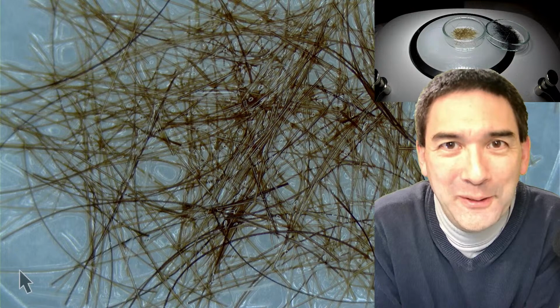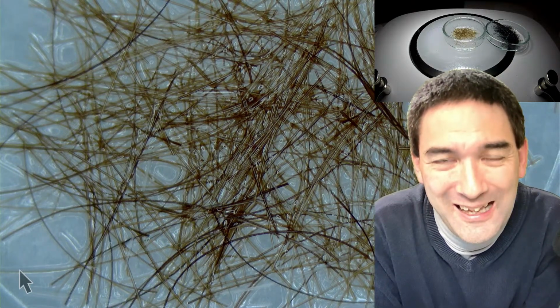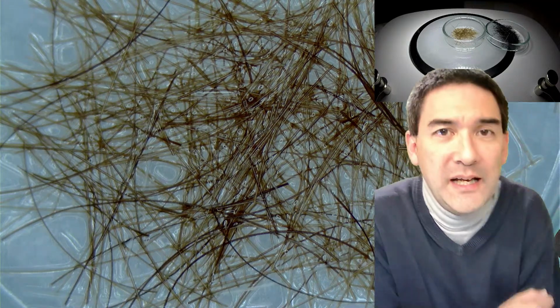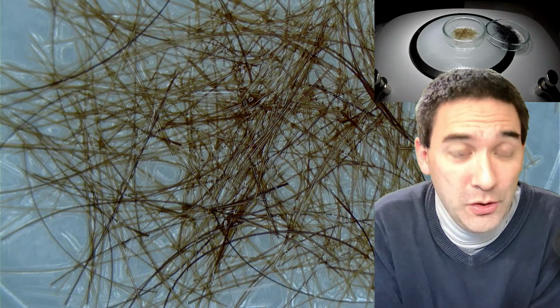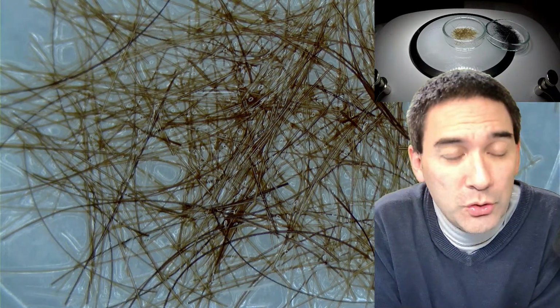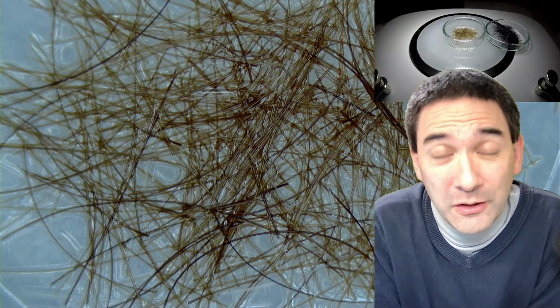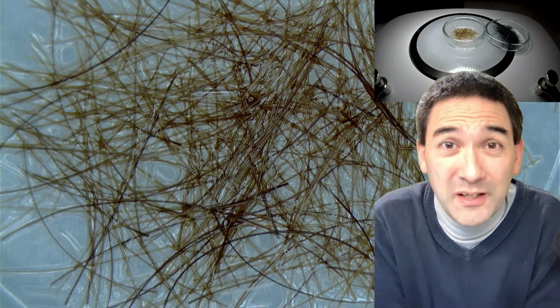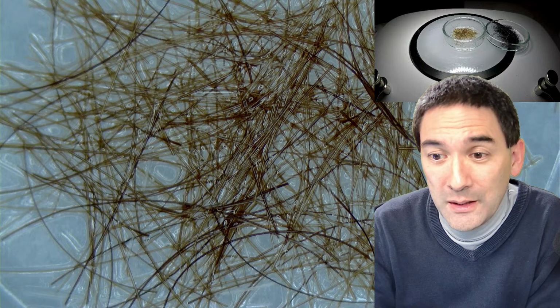Some of you remember it. We used it a couple of weeks ago when I prepared the diatom slides, right? And the hydrogen peroxide is highly oxidizing, and it reacts with organic materials, and it started to bleach the hair. So this is kind of bleached, right? I just wanted to show this to you, the effect of hydrogen peroxide on hair color. Apparently, that's why some people use hydrogen peroxide containing things to bleach and make the hair brighter.